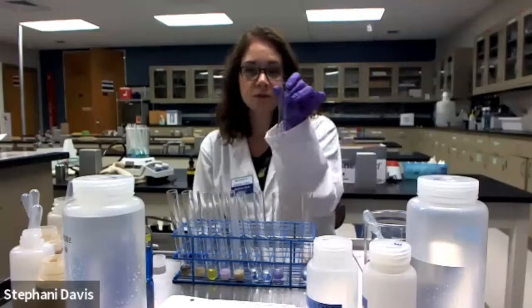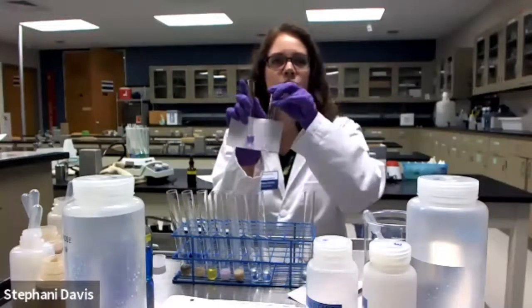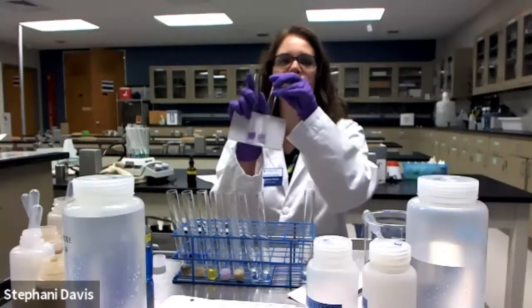Wait about 5 minutes to take those out. And let's take a look at our Biuret test. So again, our negative control looks as it should, just has a light blue tint to it. Number 2, we also expected it to be negative since it's a glucose solution, which is a carbohydrate, not a protein. Our albumin solution, that's a clear purple color, right? So if we compare the negative control to the albumin, we can tell the difference between the two. So we know our test is working.